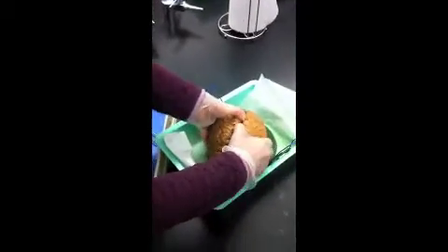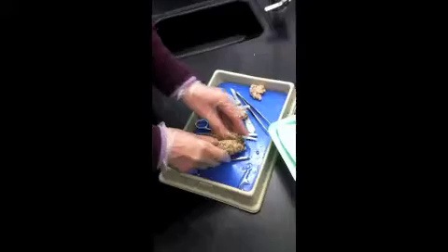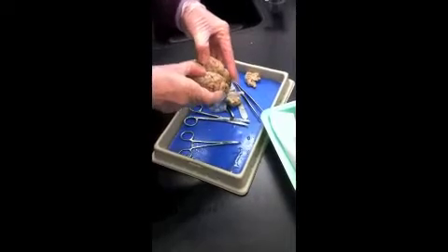On our human brain, I don't want to tug as much because I don't want to destroy this brain. But on yours, you can go ahead and just with a scalpel make a dissection, a cut right through it.